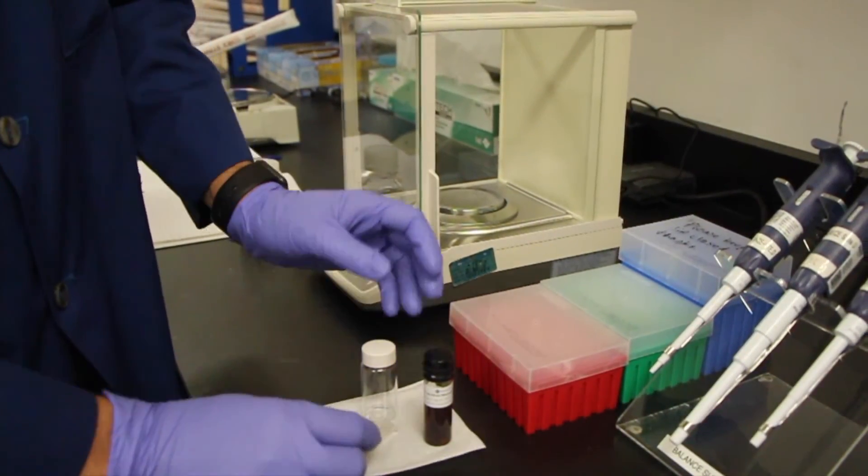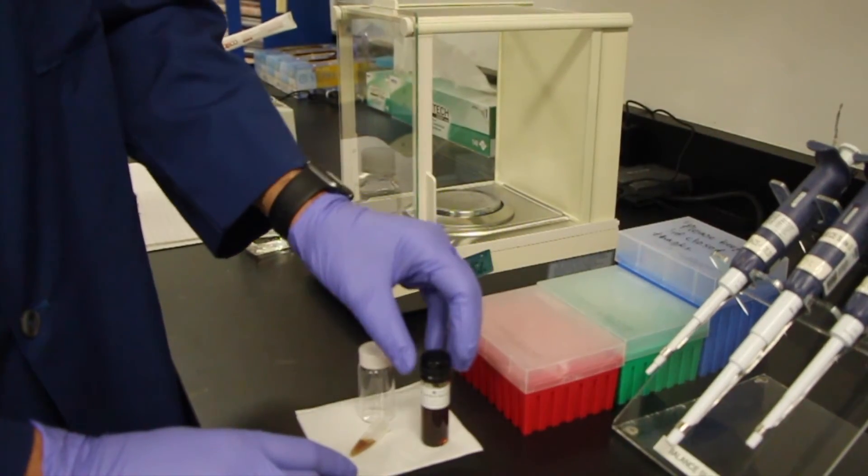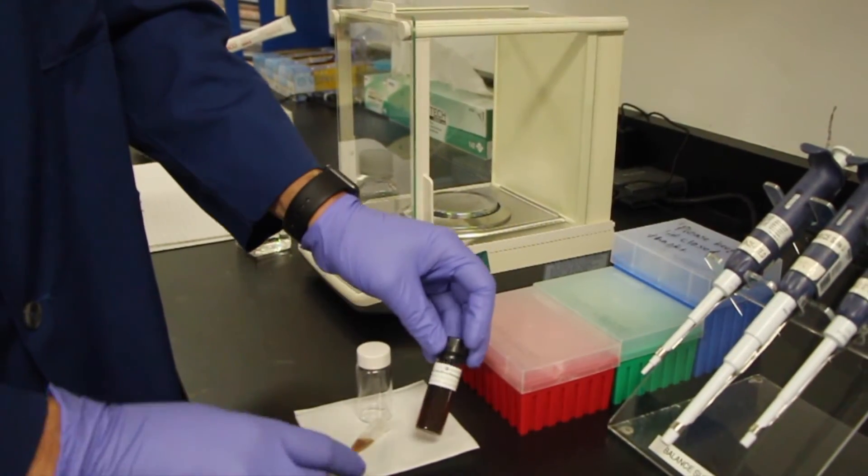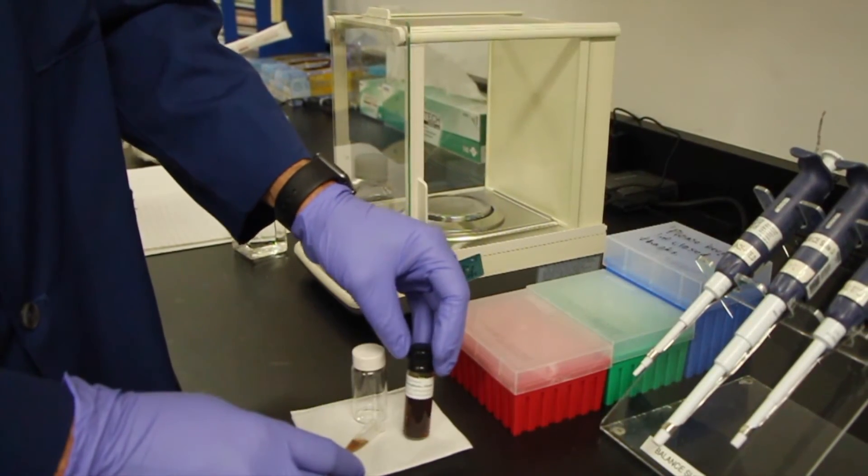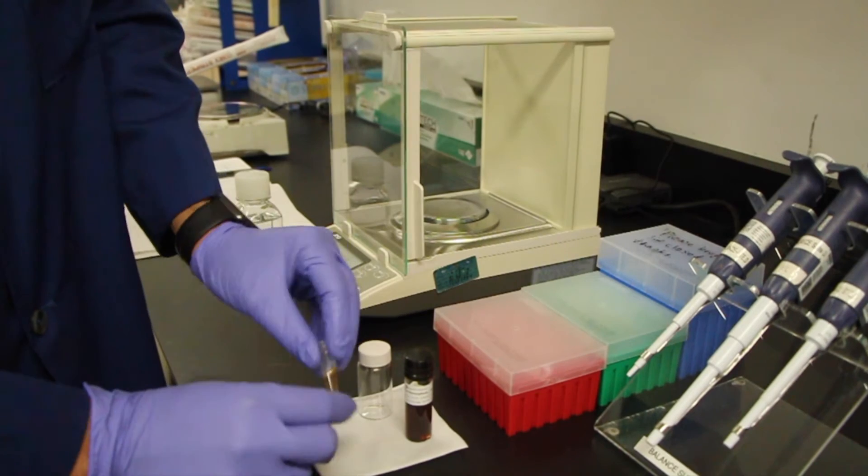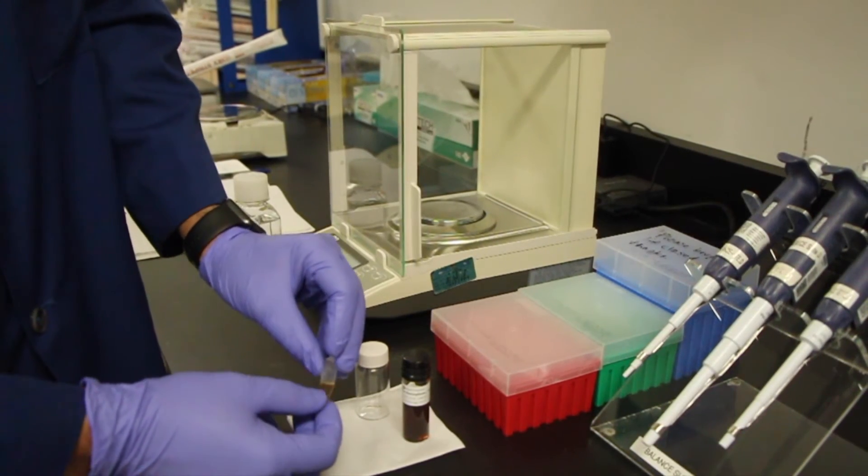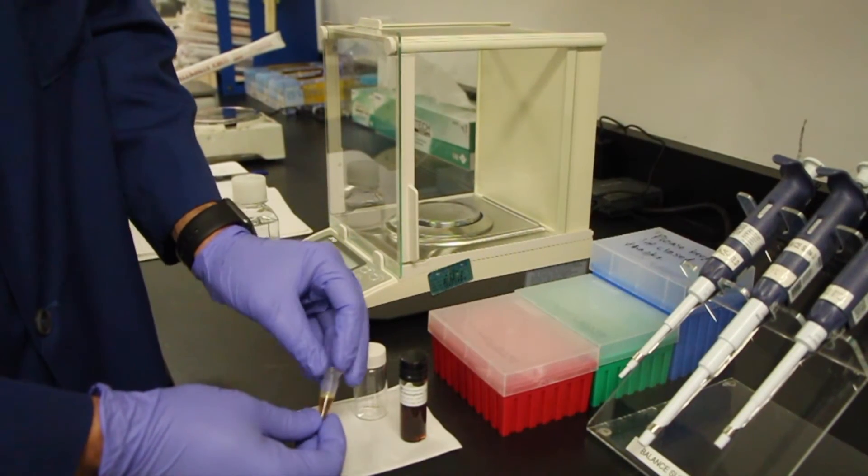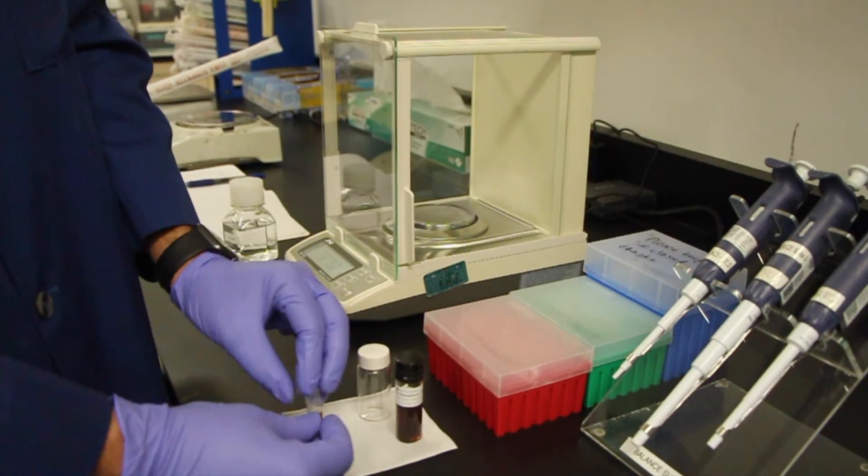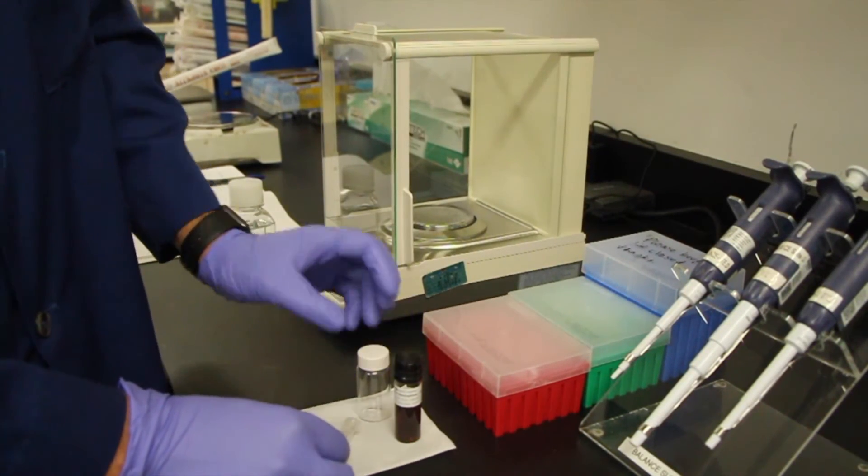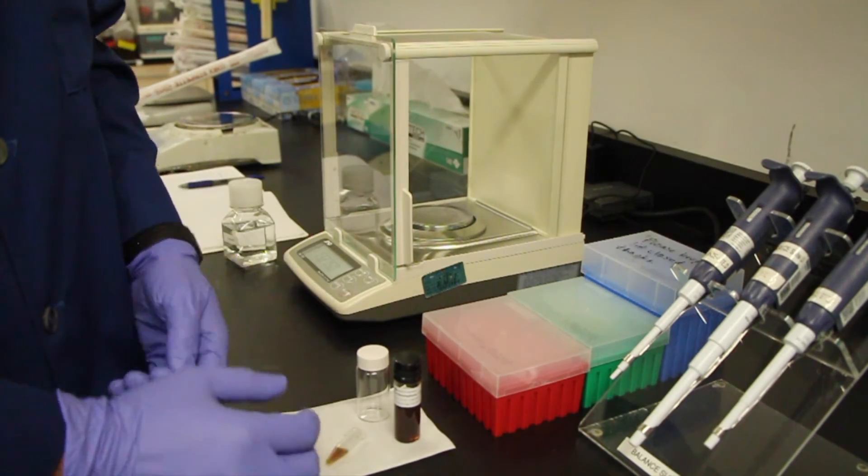We're working here with concentrated silver BioPure 20 nanometers and as you can see it's pretty dark. This has an OD or absorbance of about 166. So we're going to have to do a 166-fold dilution to measure on the UV-Vis spectrophotometer accurately.